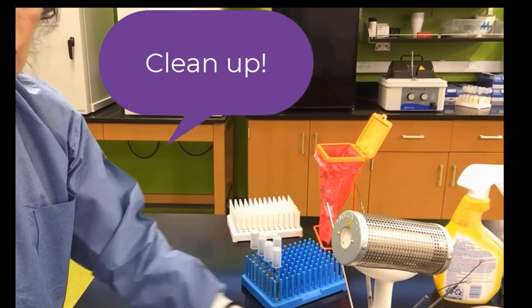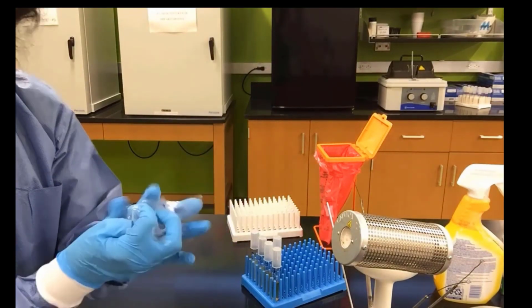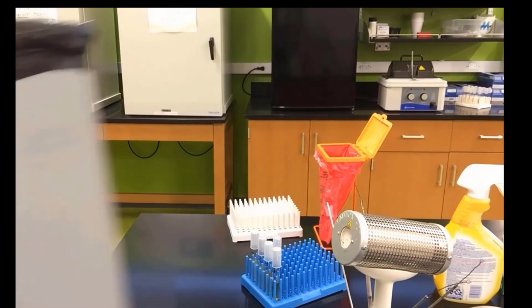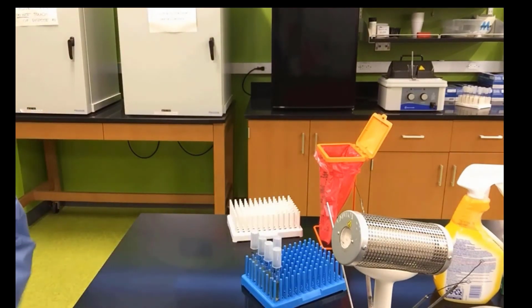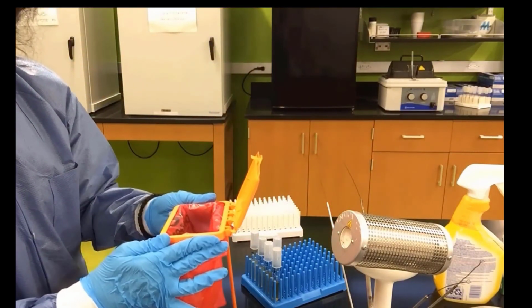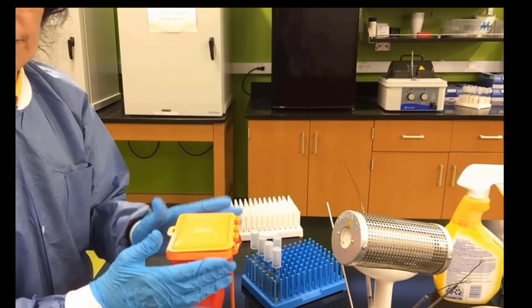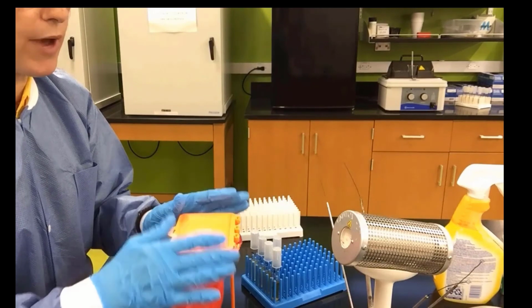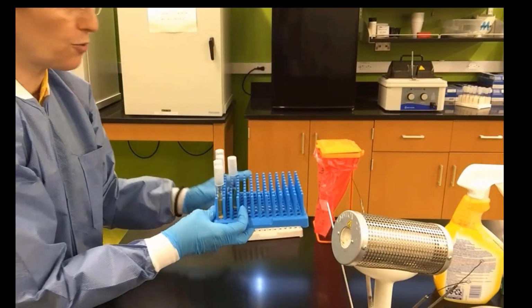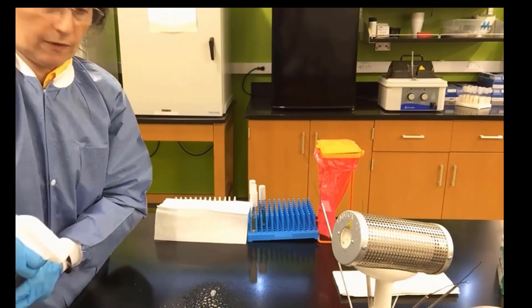Please do not forget, the next step is to clean up. Want to make sure we keep everything clean, throw away our trash in the trash can. Here's the trash can. We want to turn off our Bacti-Cinerator. Make sure our hazard trash goes where the instructor has instructed us. Usually it's placed in an autoclave either the same day or the next day to destroy the waste. We want to make sure our original bacteria are given to the instructor.